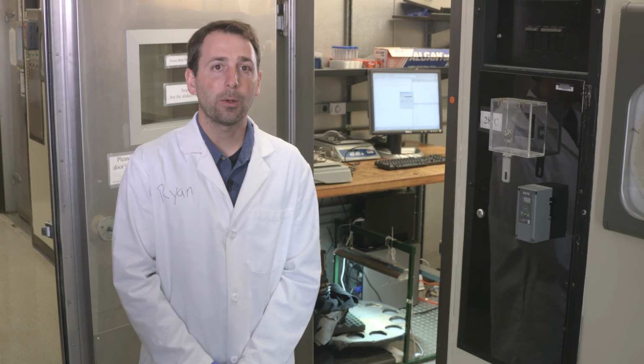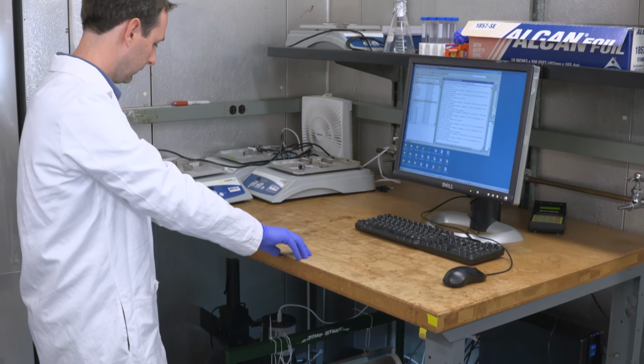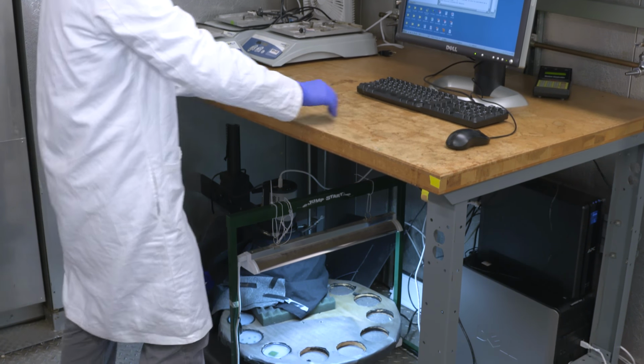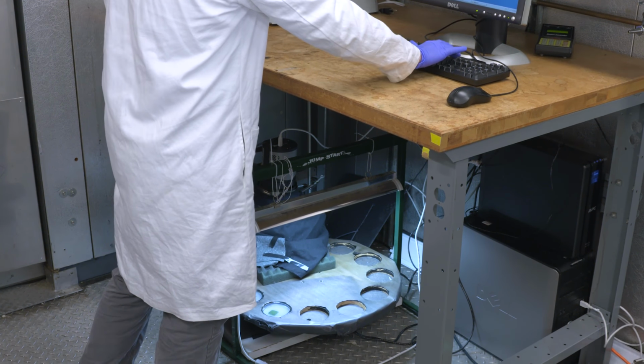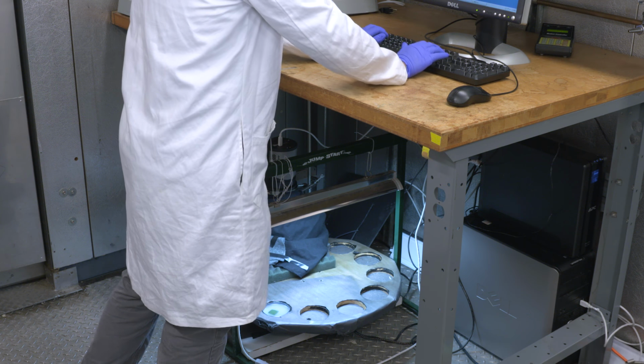The first thing we need to do is take our entrained bacteria to an imaging station where we can visualize the luciferase. Notice that our camera setup is in a 30 degrees Celsius warm room. This is to ensure that the temperature is constant throughout our experiment and that the growth of the bacteria will not be hindered.